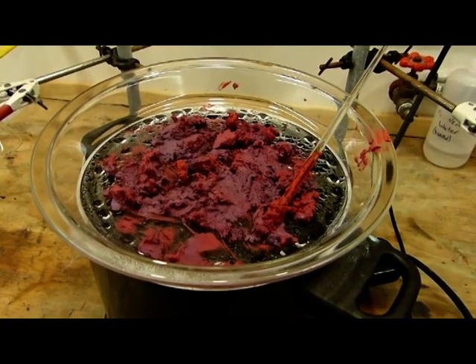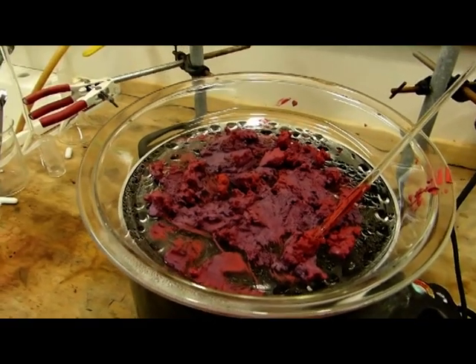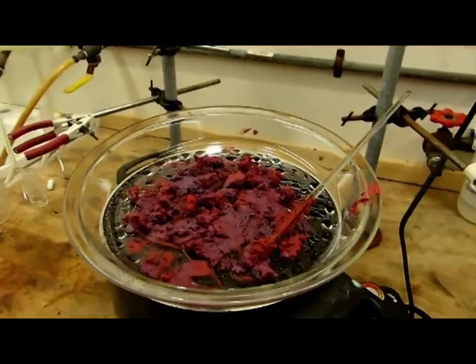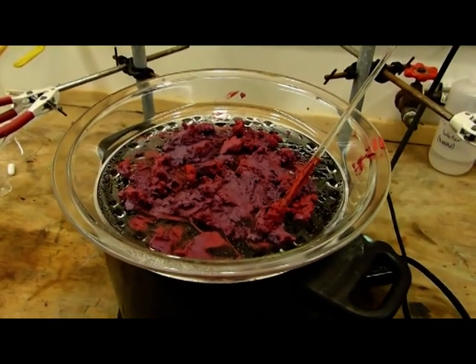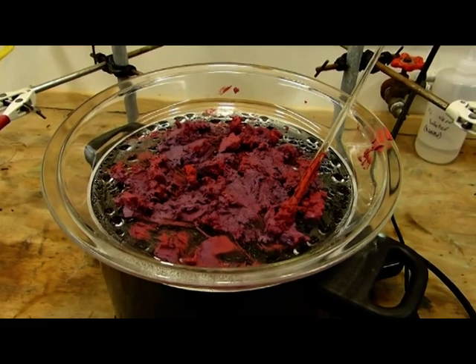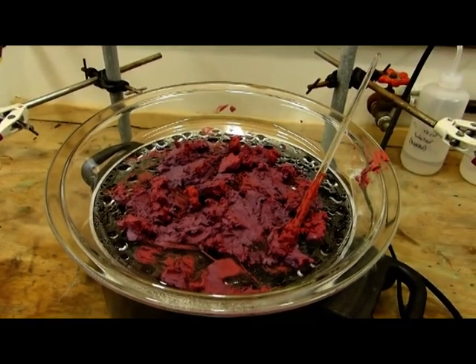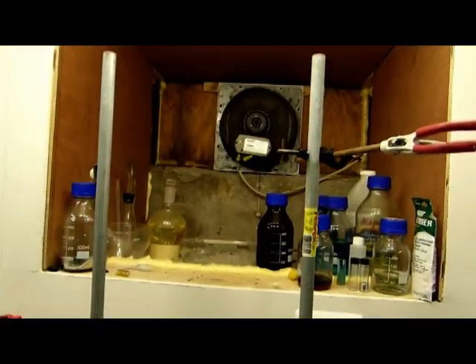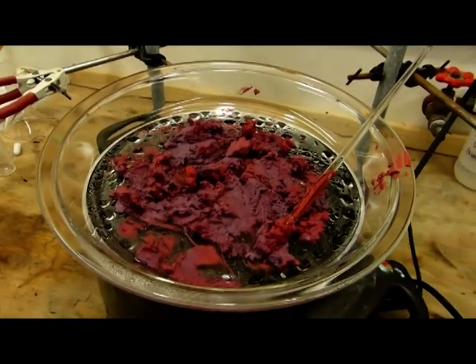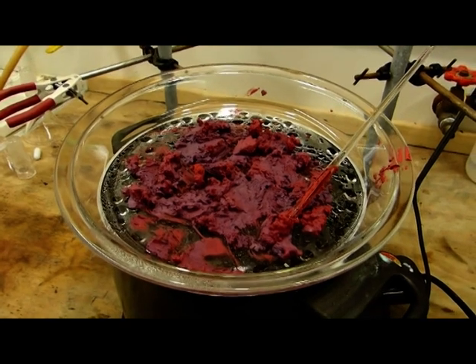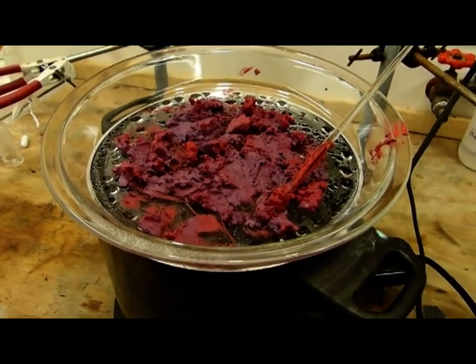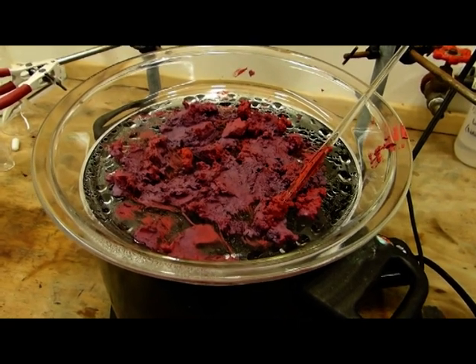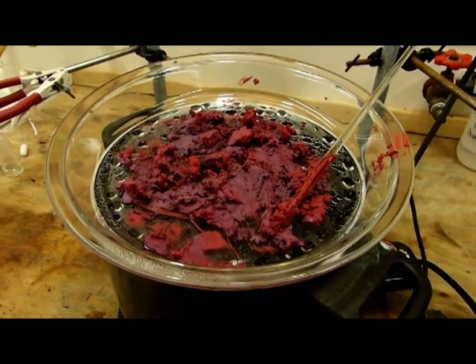This stuff's been on the water bath for about 10 minutes now and you can see the nitric acid vapor is coming off of it. All that steam is nitric acid vaporizing, very very corrosive. So obviously you'll do this in a hood, and it's going to eat the crap out of all the metal that's anywhere downwind. So make sure you do this in a dedicated space. Should be about an hour until this is dry. Hopefully we got enough sulfuric acid out of it to let it completely dry, but time will tell.